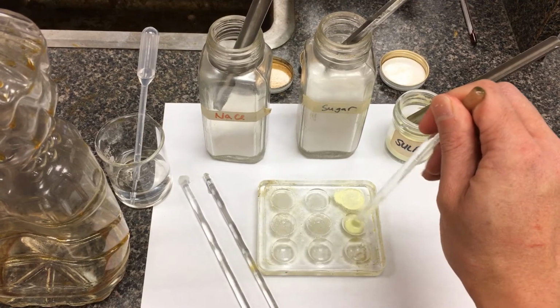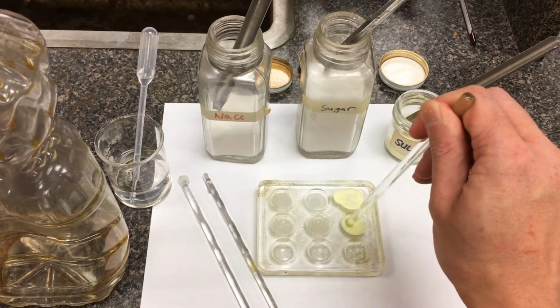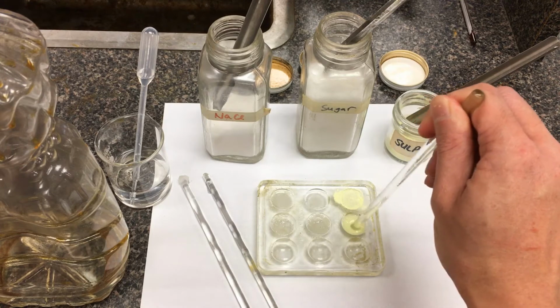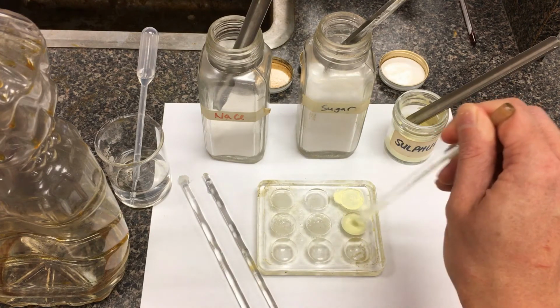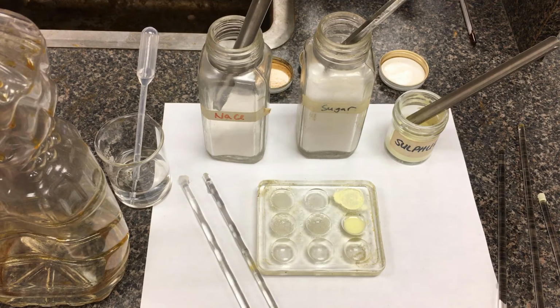Okay. Again, there's always a little bit of contention, just in case I didn't have enough solvent and I actually oversaturated the solutions, but we're just trying to make some qualitative comparisons. What does it look like? Which one does it seem to have dissolved better in? And solubility does vary, it changes with temperature, it changes with the amount of solvent. Okay, there's a lot of variability in it, but essentially in this lab we're just saying, did it dissolve, is it soluble?